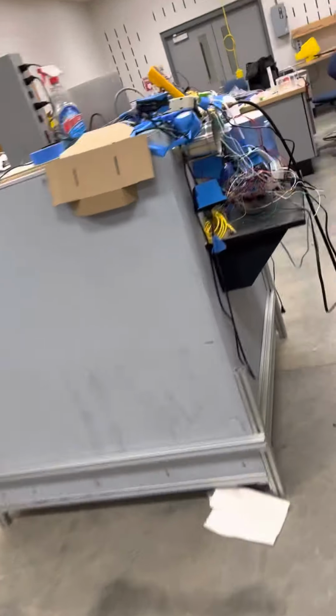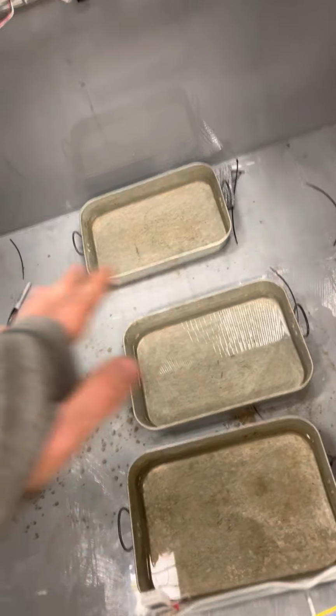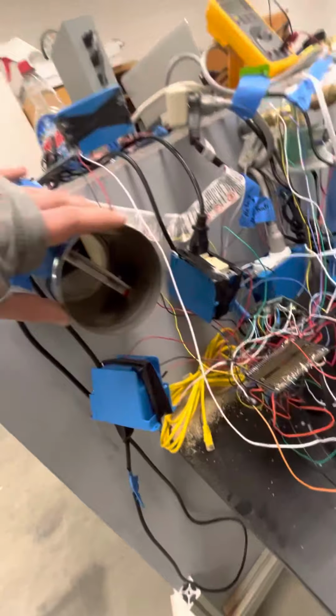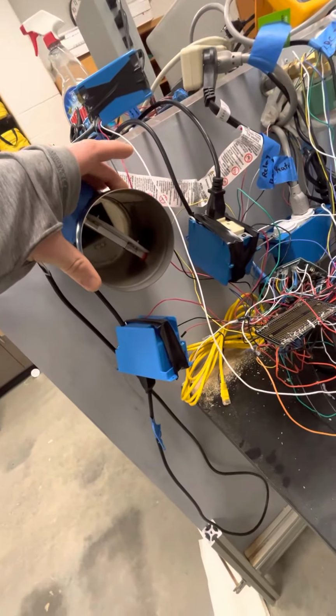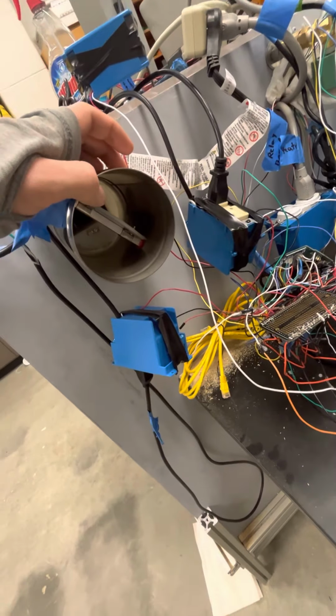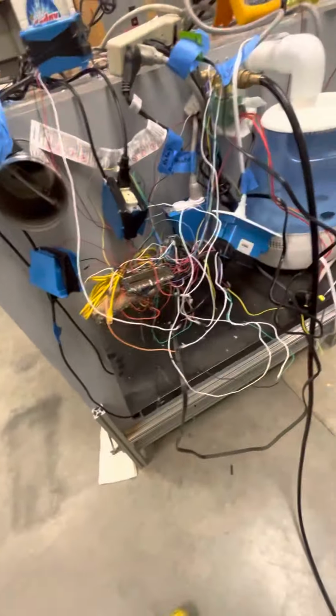The advantage of this system is obviously we have significantly greater build volume than the other chamber. We can fill this entire area with dirt. And then we have CO2 sensors like this one right here, where we can measure the CO2 flux by shutting off this valve right here. So the entire system is going to be fully enclosed. And then over a period of time, it's going to measure the CO2 flux inside the dirt. This is a study that hasn't been done before.